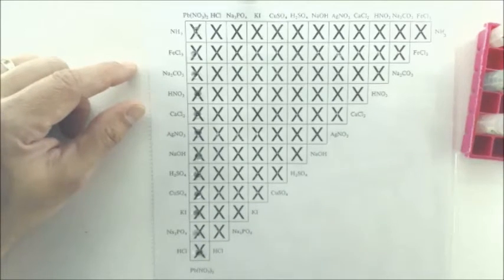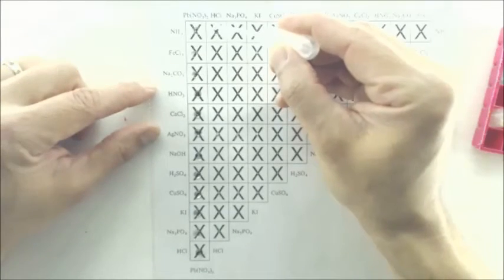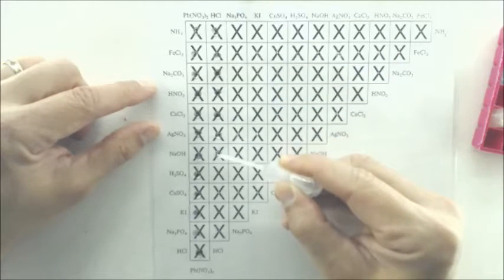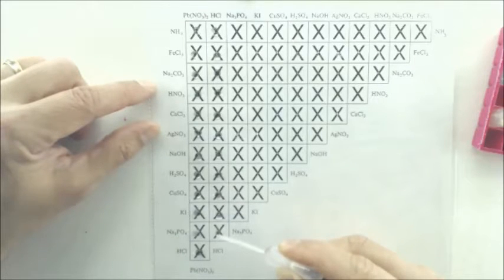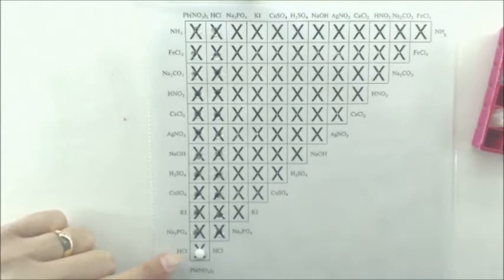And then we're going to go with the HCl in the second column. Again, we're not really reacting yet. Just kind of lining them up. Now when I get to the bottom of this row, I'm going to go around the corner here to the left, in between the HCl's, and this will be our first reaction actually right down here. So we get a white precipitate right down here, a nice bright white precipitate.